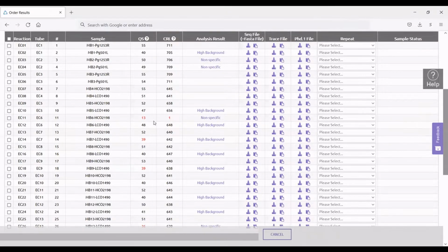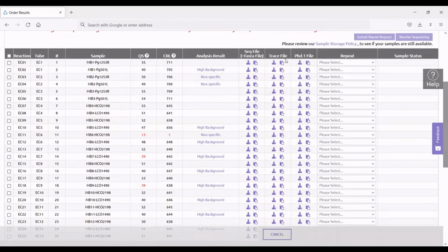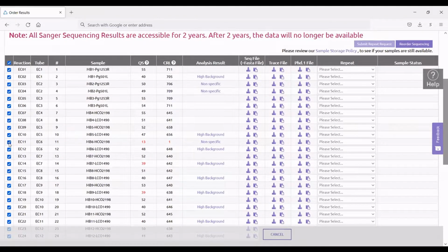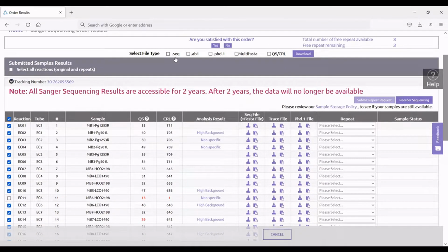And so the deliverables that are returned to you are three different types of files. You have your FASTA sequence file, your trace file, which will be used to visualize a chromatogram of the read, as well as the phd.1 file. And so all data is better than no data. So I always suggest to select everything. I'm personally going to deselect this one just because I can already tell that that didn't work. And if you go up to the top here, you can select which of those three sequence files you would like to download. In my case, I always download all three.